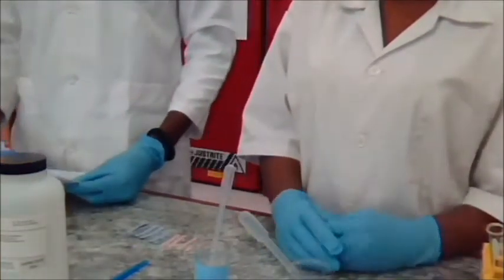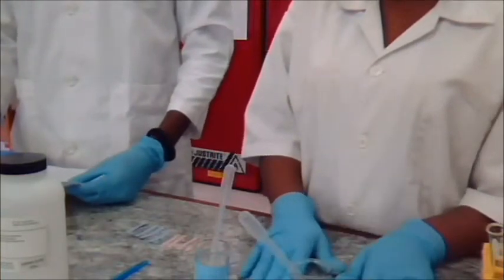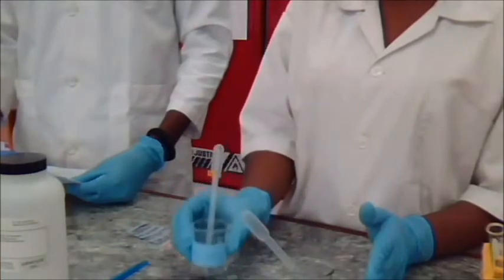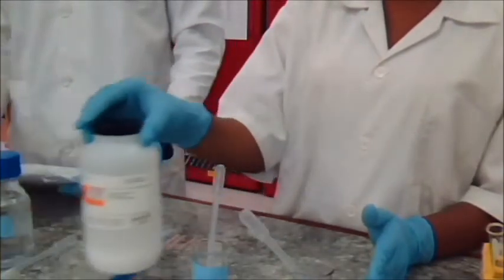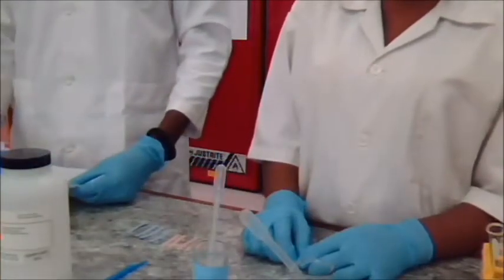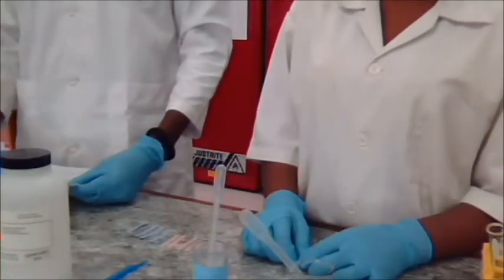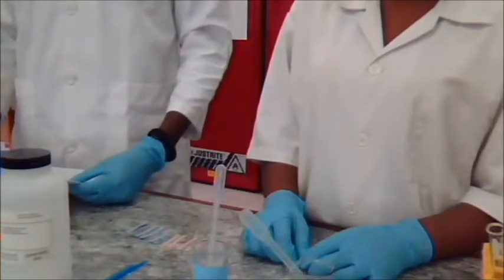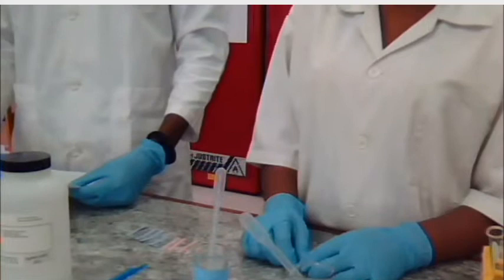We're going to use 3 known compounds: aniline, acetone, and benzoic acid. Solubility tests are done in sequence: water, then base, and then acid. If your compound is soluble in water, you do not need to check for solubility in the basic or acid solutions.